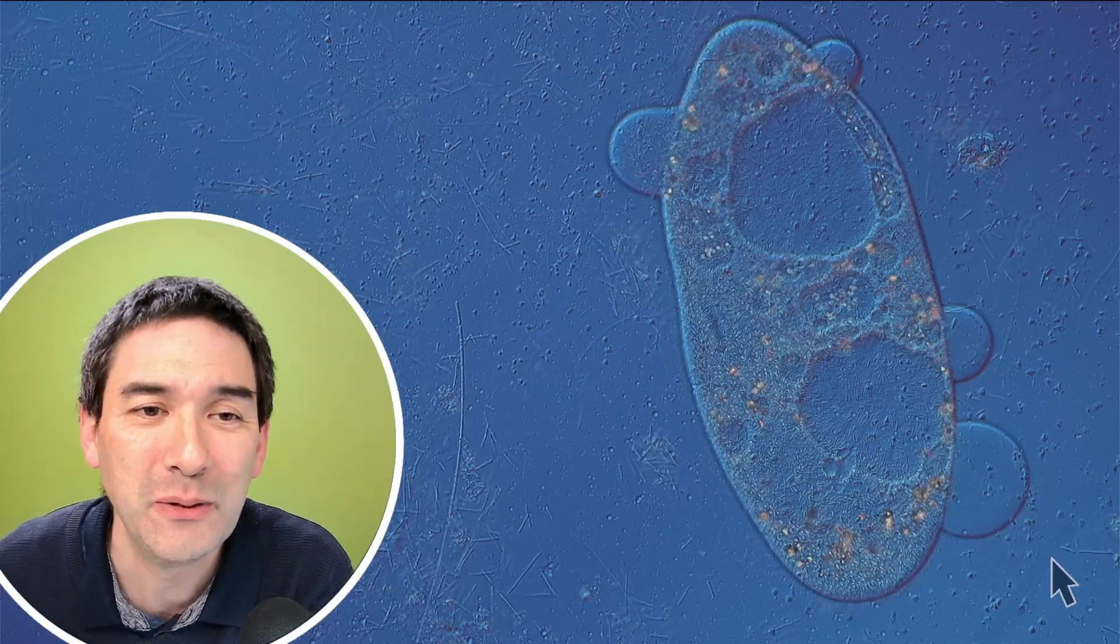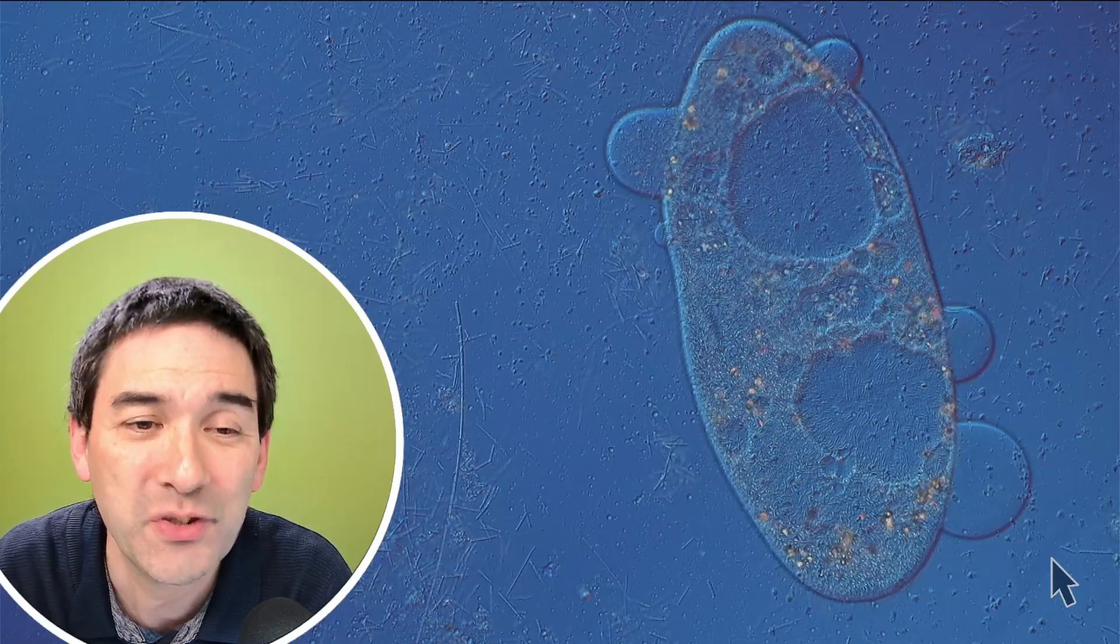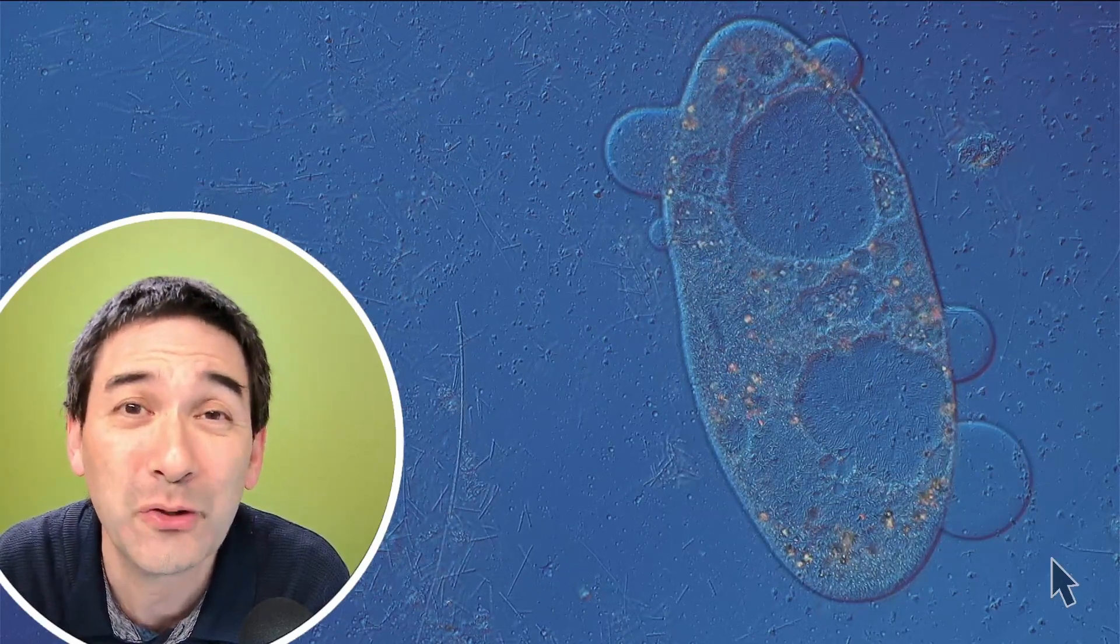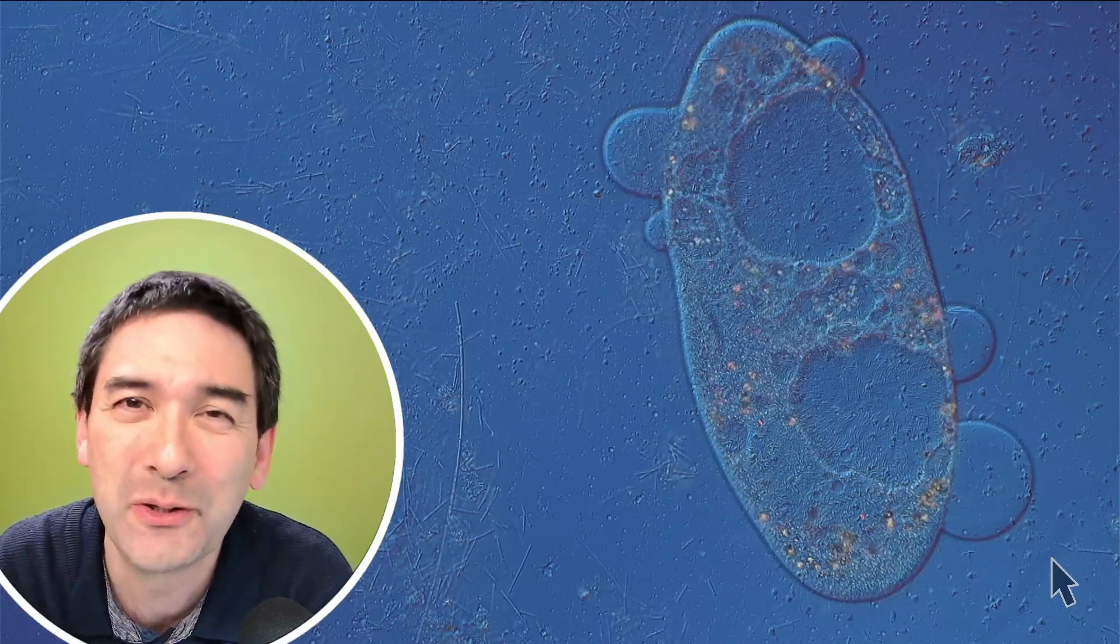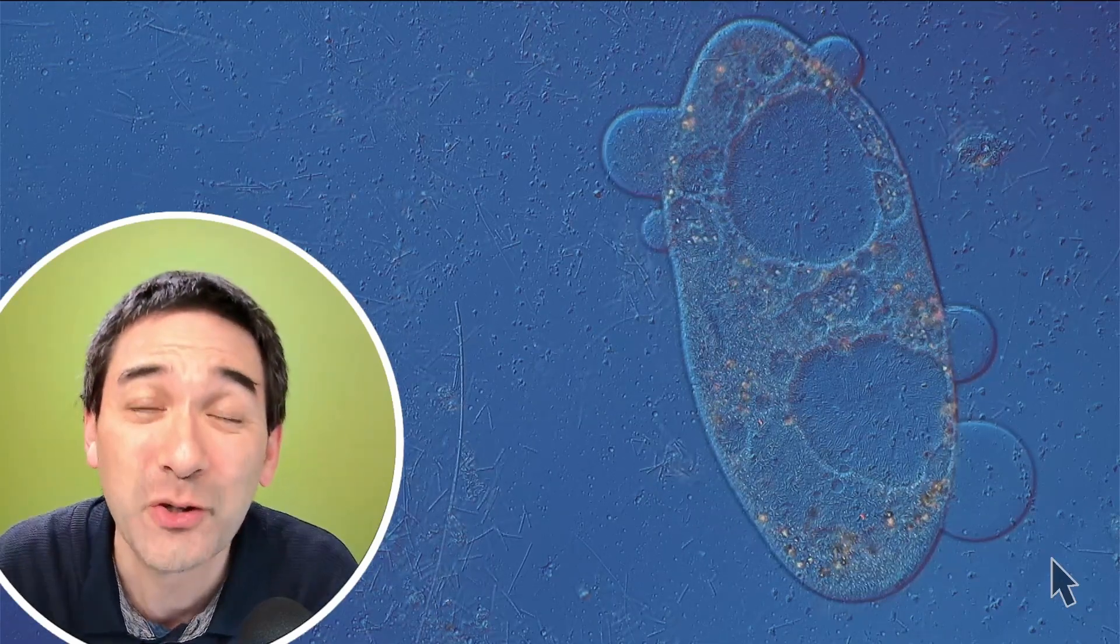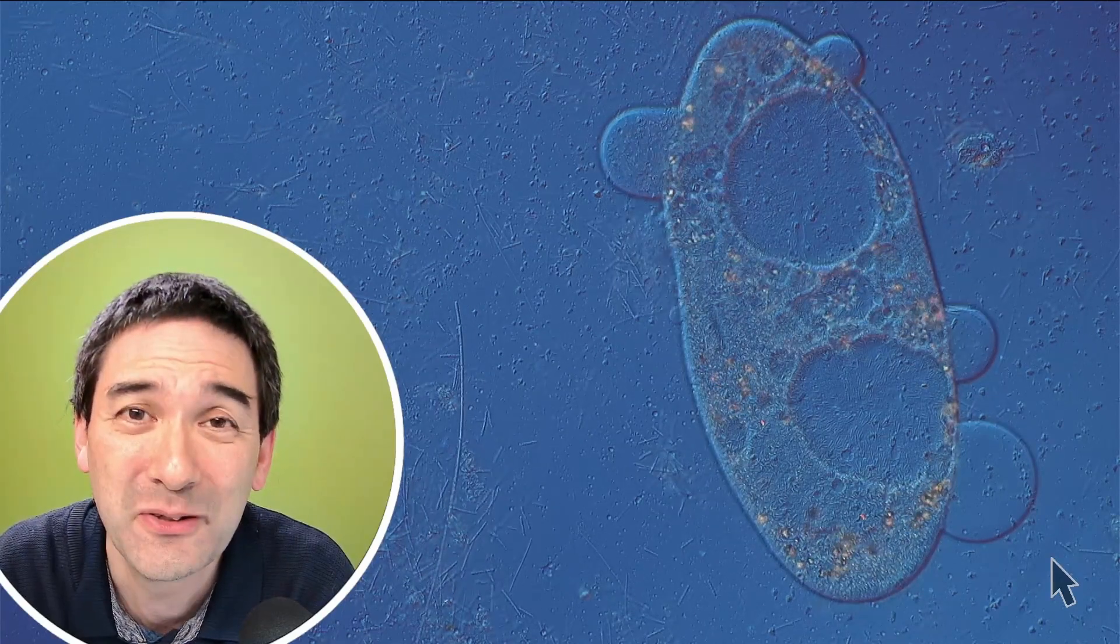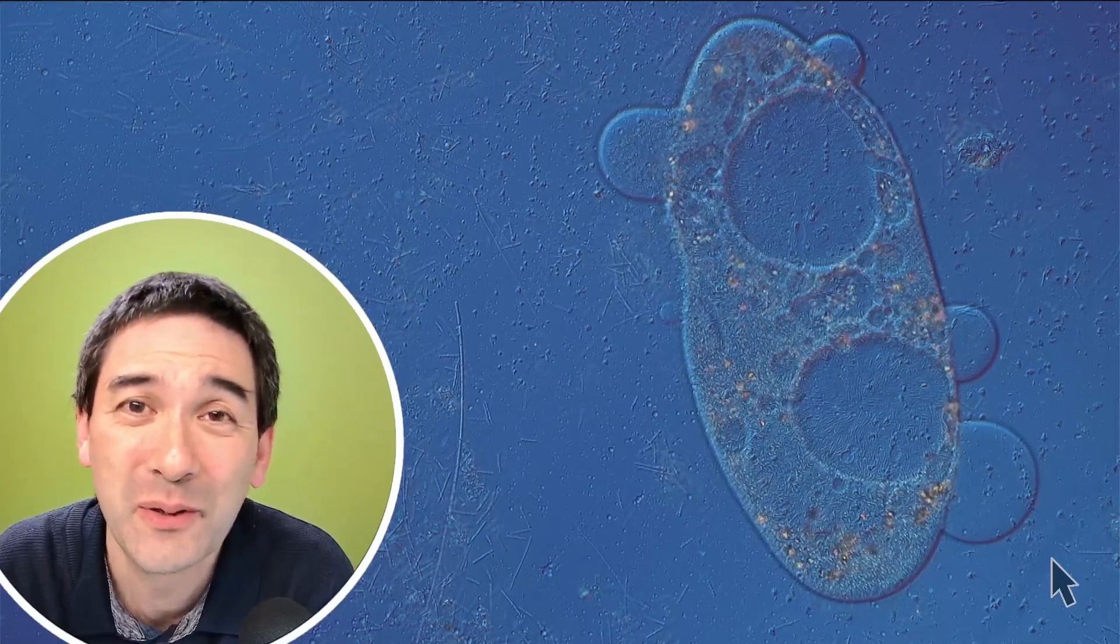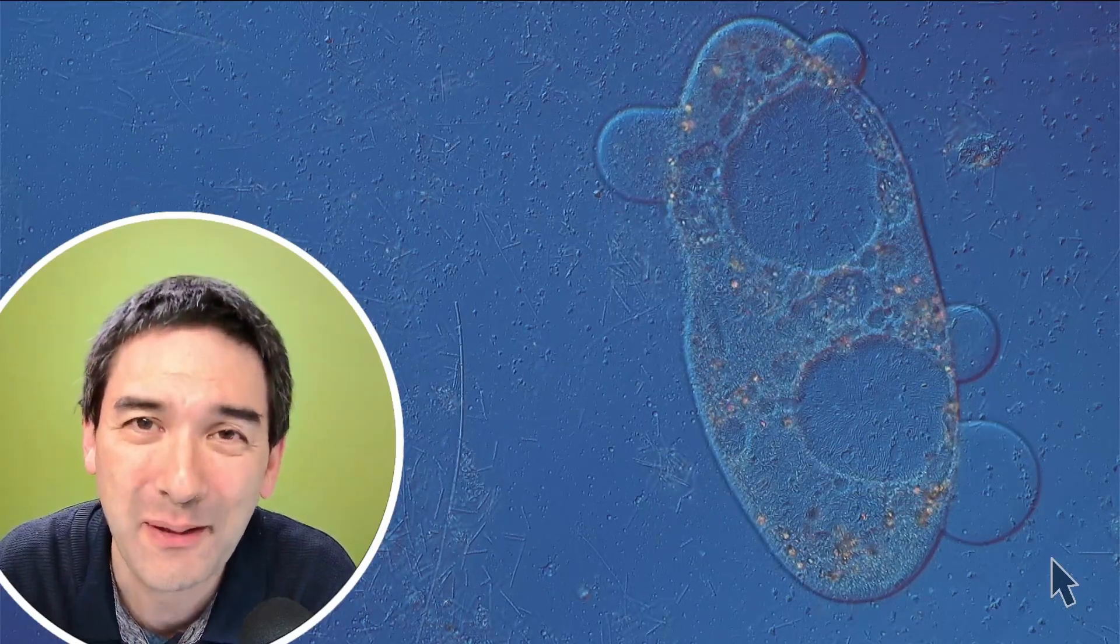I just wanted to show this to you, also to illustrate how you're able to grow and enrich those ciliates yourself. However, I do want to warn you again that every time when you're adding some food to a water sample, you're growing bacteria and other microorganisms to very high concentrations. You might want to be a little bit careful and just observe the basic rules of hygiene and make sure that you always disinfect the tools that you're using because you do not want any of these bacteria to actually cause any problems. I'm going to leave it at that. I hope that this video was informative for you and interesting. Happy microbe hunting as always. See you around next time. Bye bye.